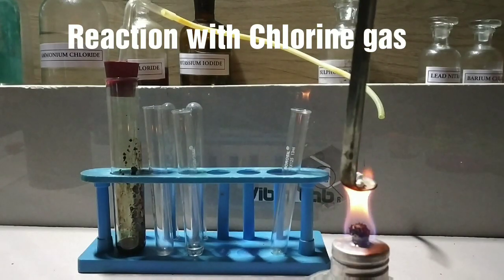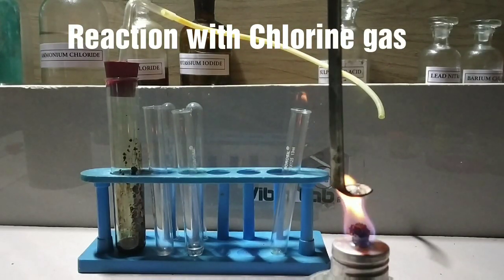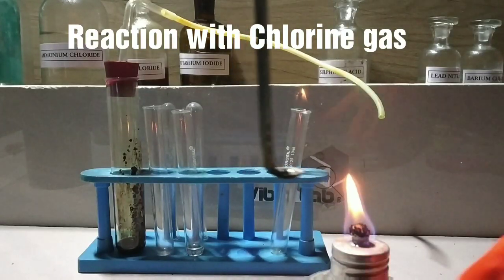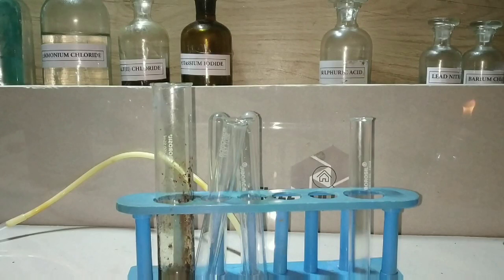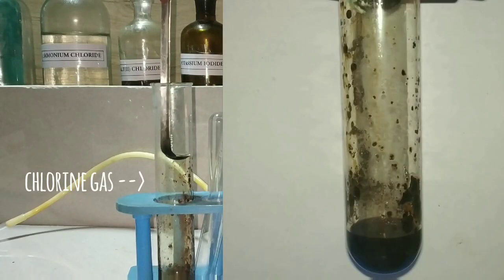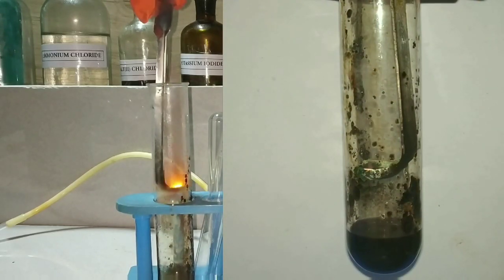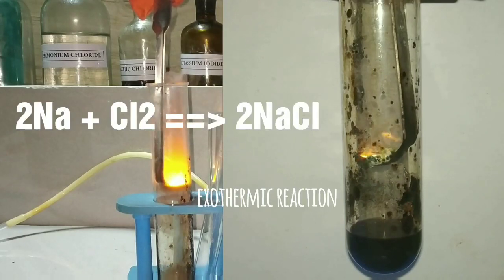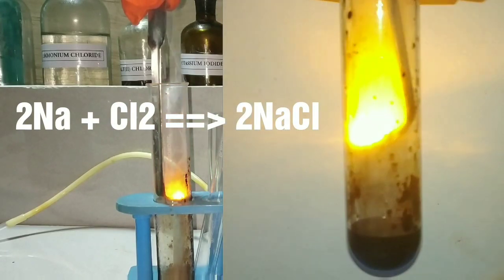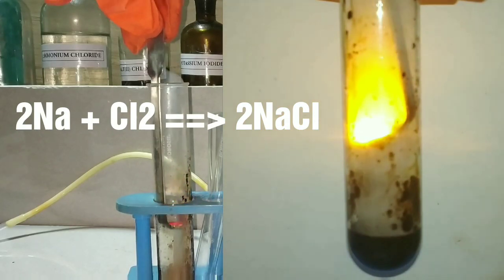The reaction of sodium with chlorine gas. I have synthesized chlorine gas by mixing concentrated hydrochloric acid with potassium permanganate in that test tube. I have heated a piece of sodium metal until it melted in a spoon, and now I am introducing that spoon into the test tube containing chlorine gas. You can see that there is an immediate reaction and the sodium metal catches fire, and there is a direct reaction between sodium metal and chlorine gas forming sodium chloride.